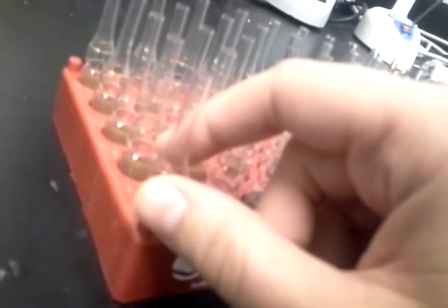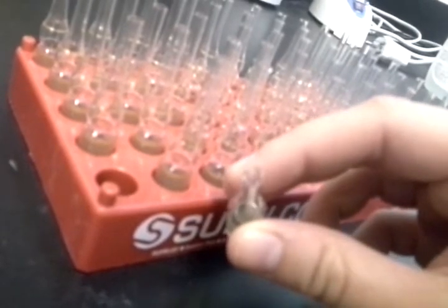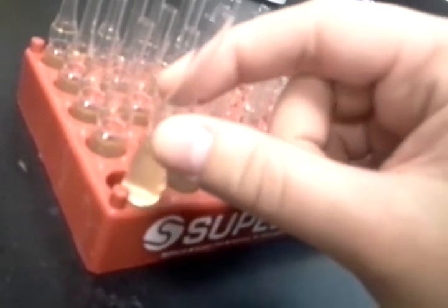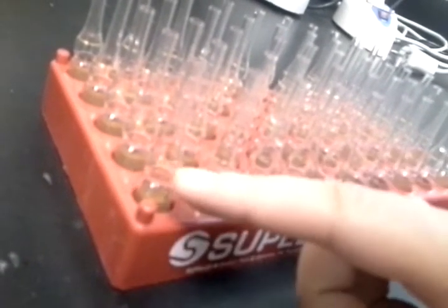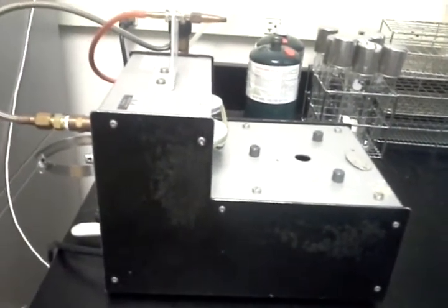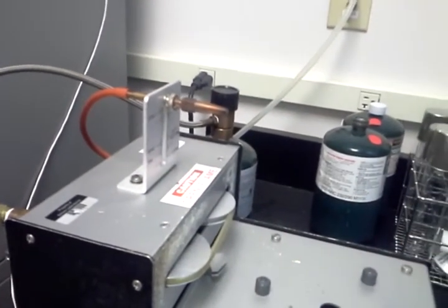As you can see, these little vials are open at the top. What I'm going to do is use flame to seal the top so that these little vials, or ampoules, are waterproof, airproof, completely sealed. And for that, we're going to use this little piece of equipment here — the flame will come out of here, and that's where I will be working.